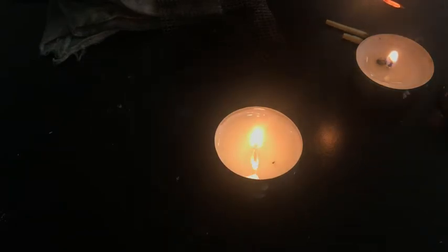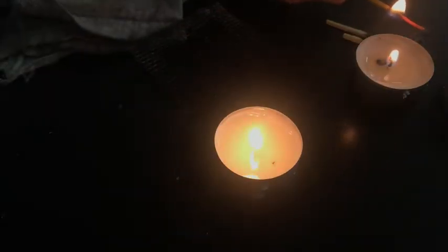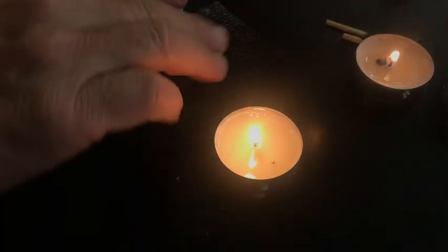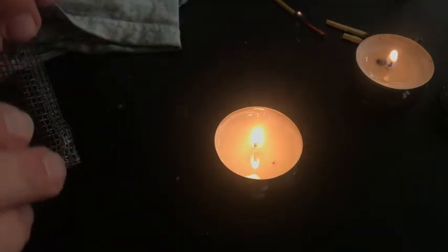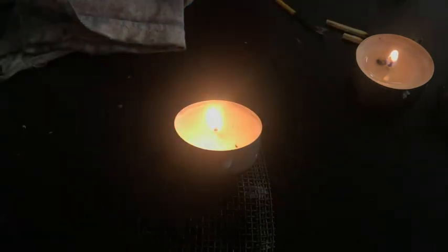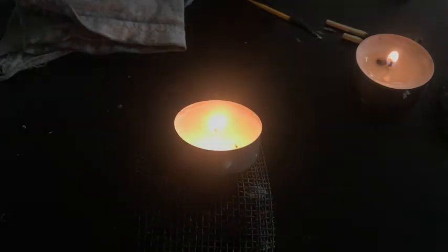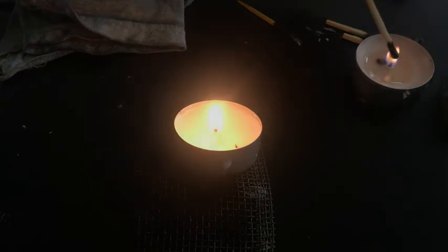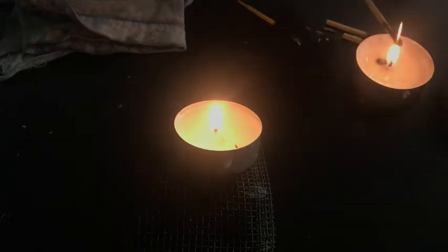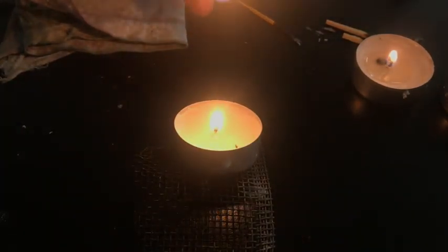Blow out the candle, and then without touching, that worked, but I don't know if you could see that. So let's make a better view. Readjust. Okay, maybe that'll work. And let's get our match. So try it one more time. And I don't know if it's any better. Come on. Okay.